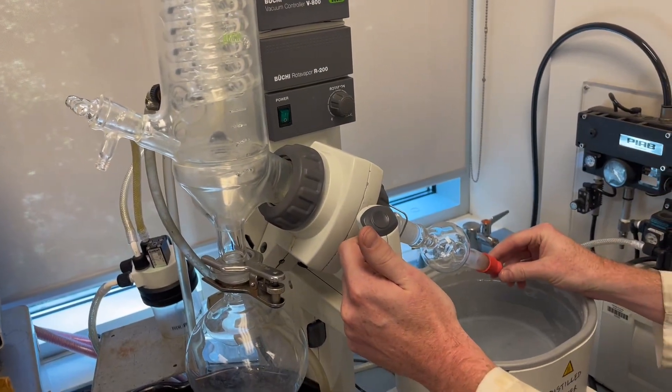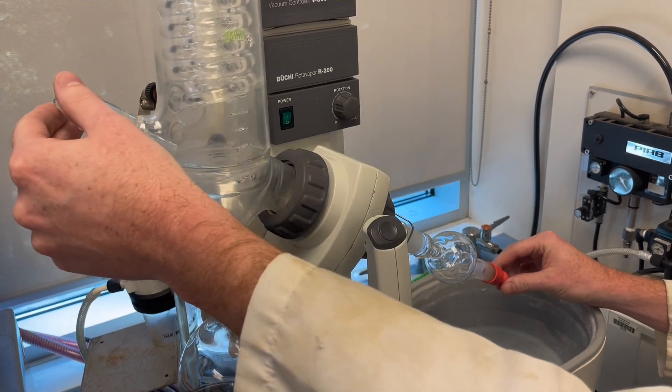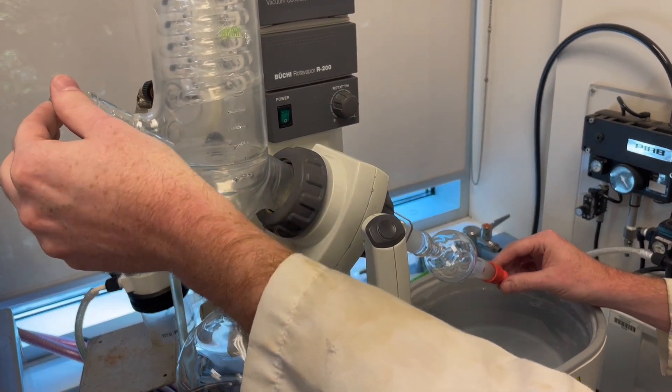Now it's important to hold this when you let the air back into the system, because the influx of air can sometimes knock these off the end if they're not on tightly enough.